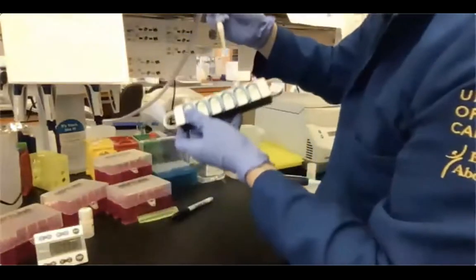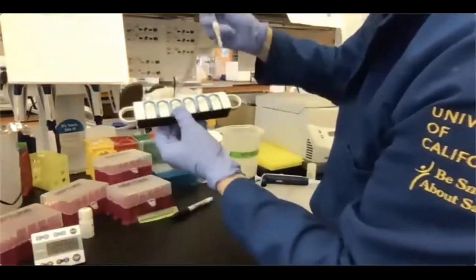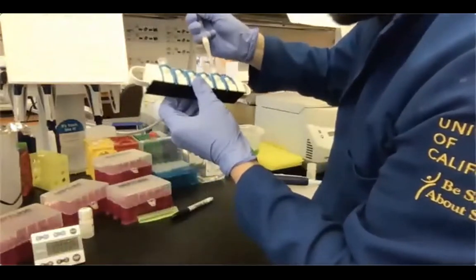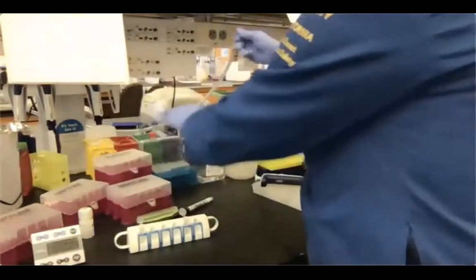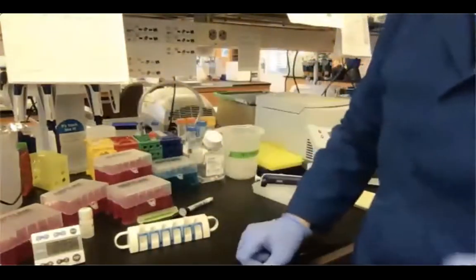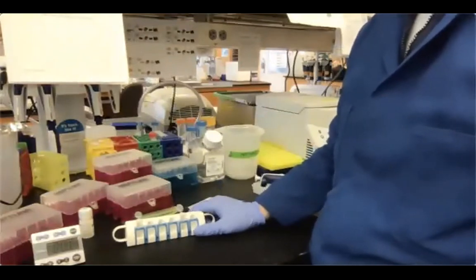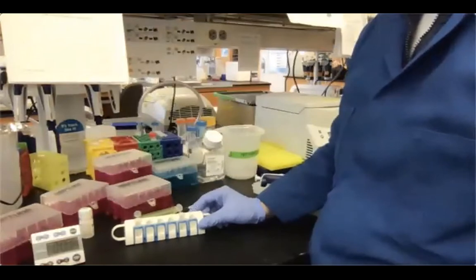And then I'm going in on the other sample and remove the ethanol at the bottom of the tube, and then looking for some other droplets. Okay. Now we set the timer for 3 or 4 minutes, and then check frequently whether our samples are dry or not.